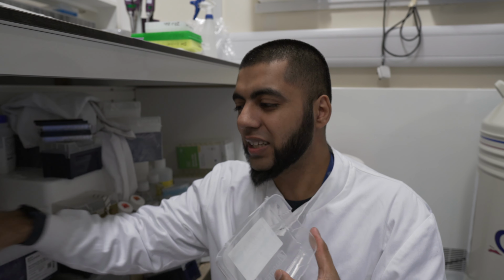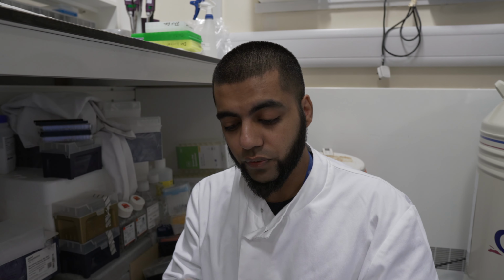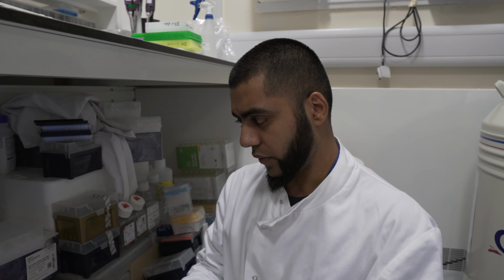So I'm hoping to share little tips and tricks that I've learned over the years in research on this channel in these types of vlogs. So do let me know if you want to hear more of those kinds of tips. But that's your tip for the week in terms of lab tips.